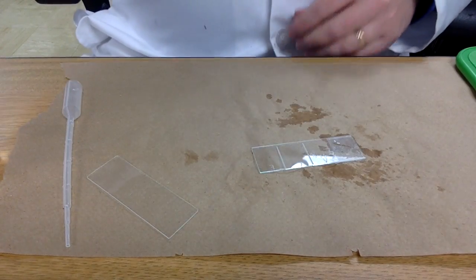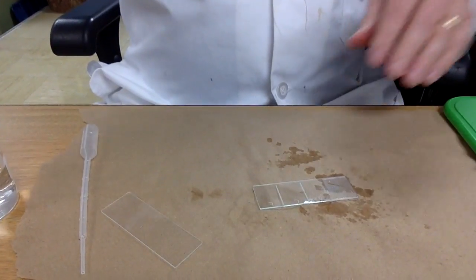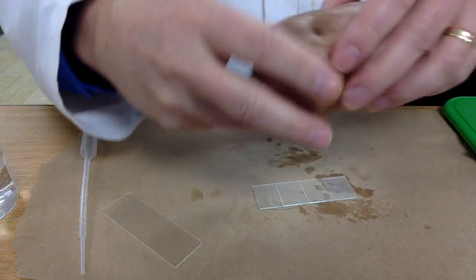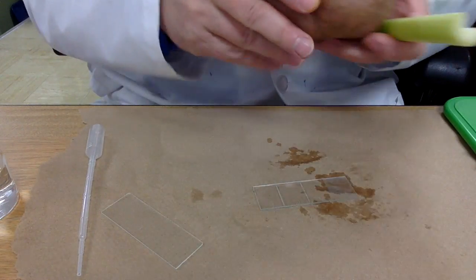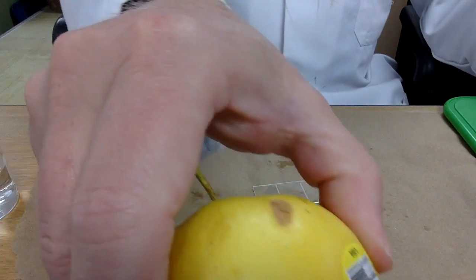The slides that we prepare today will be of plant cells: potato, celery, and apple.